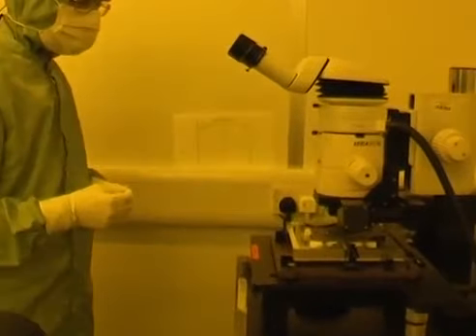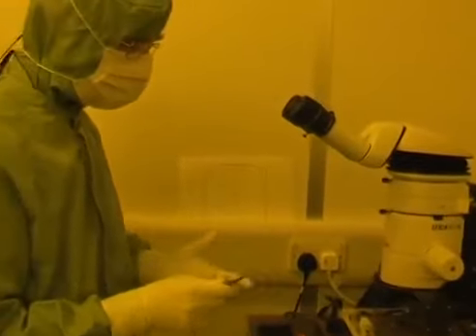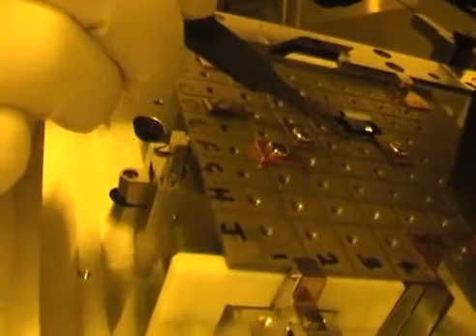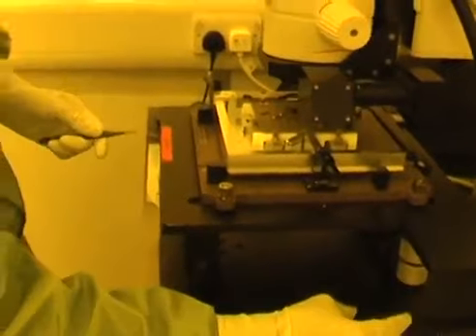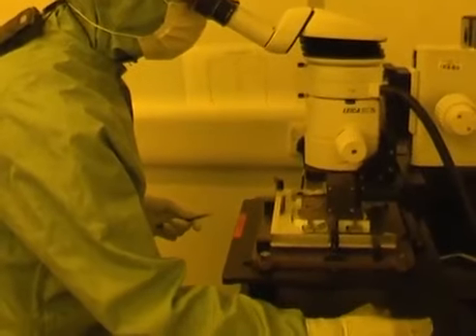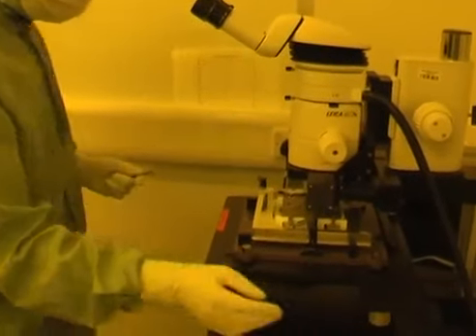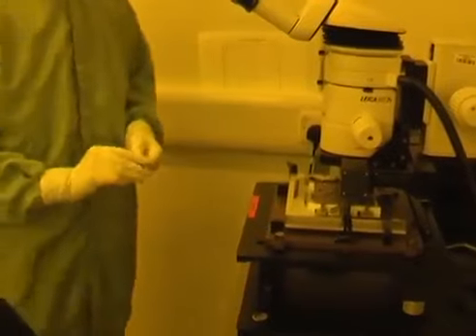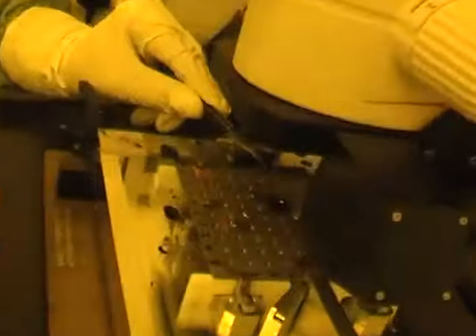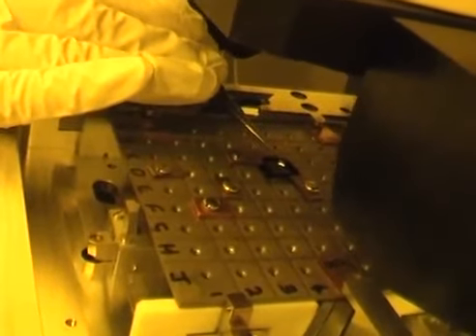Okay, I can see it's quite badly aligned by moving from one end to the other. I need to nudge it in one direction or the other. So, small nudge. Let's see what I've done. That's actually made it worse, so I need to go in the other direction. This is partly because I haven't done this for a while and I've forgotten which way is which. Try that.